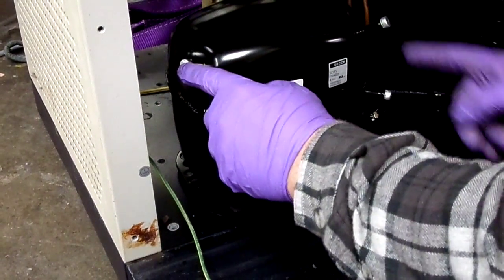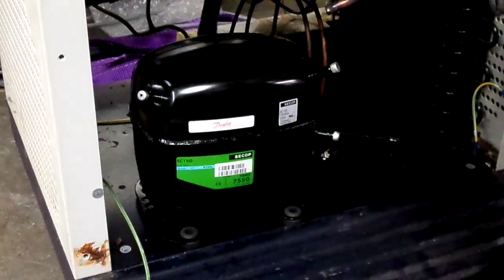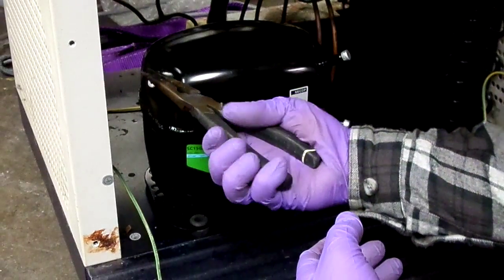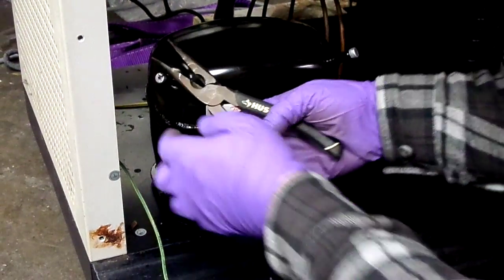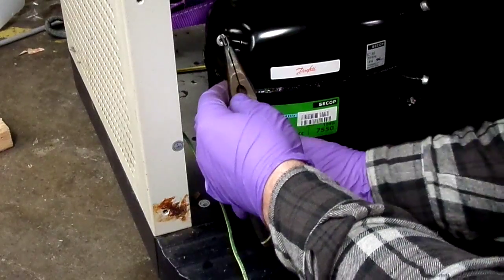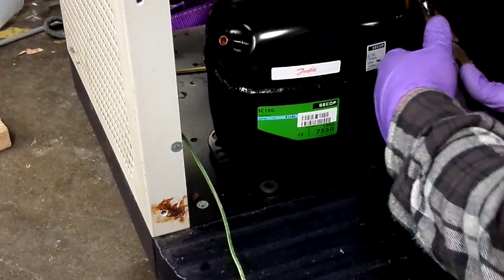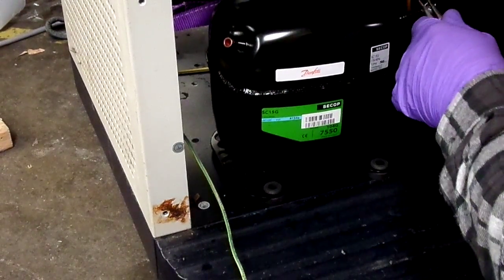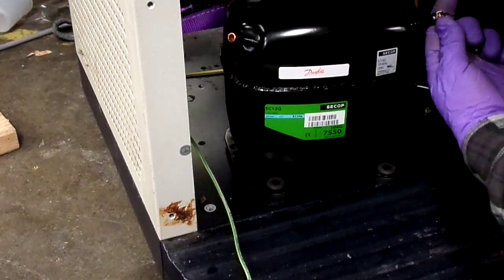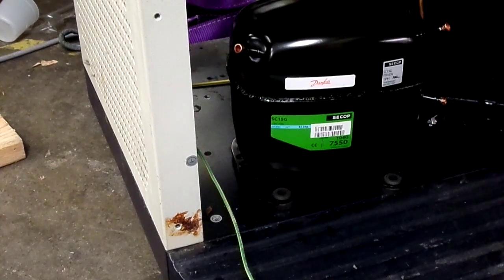So as you can see, it's got little caps on the input and output of the compressor from the factory. It has a vacuum inside of it. So if you listen real close as you do this, you hear it suck in a little bit of air. Which is another reason why we evacuate at the very end. So I just kind of crimp and crimp and crimp and pull and crimp until it comes off. I'm sure there's a better way of doing this, but I haven't figured it out yet. Nailed it.